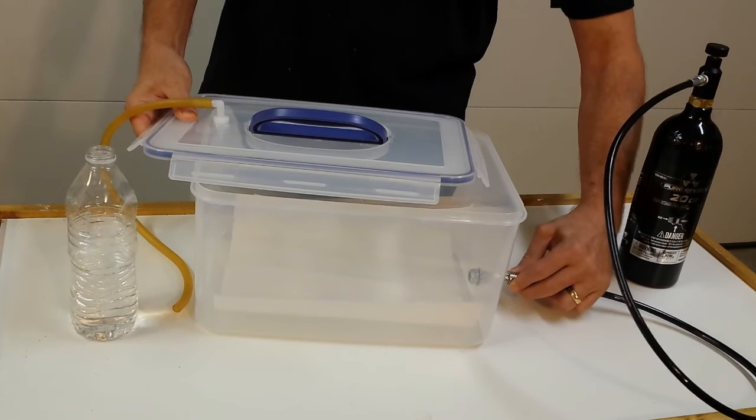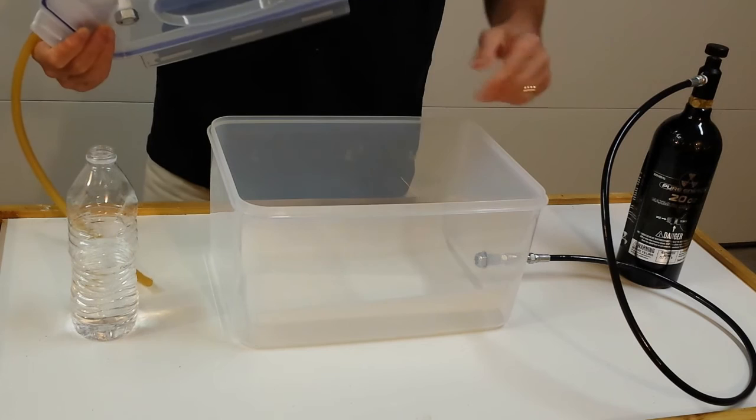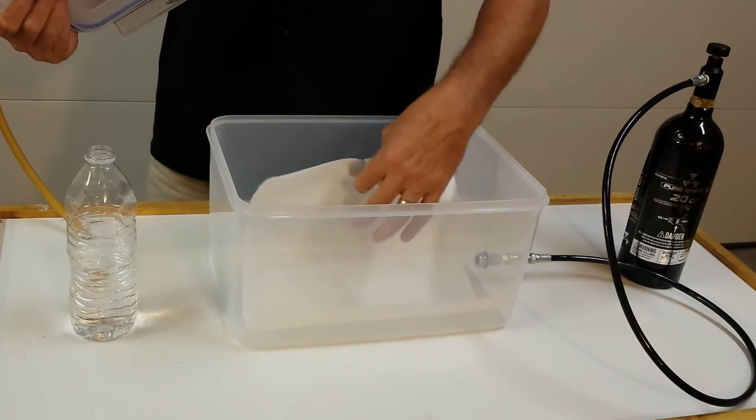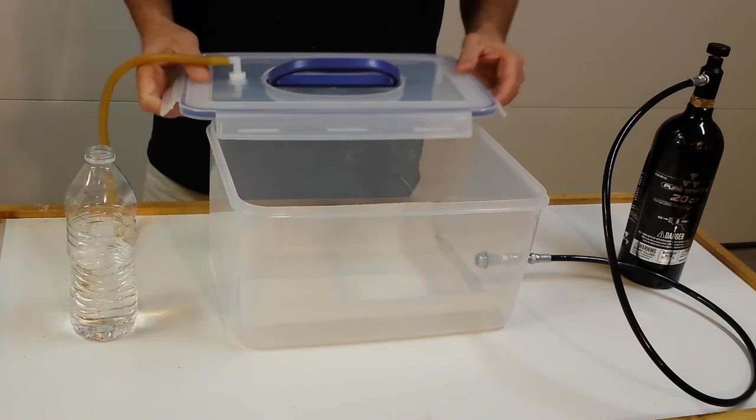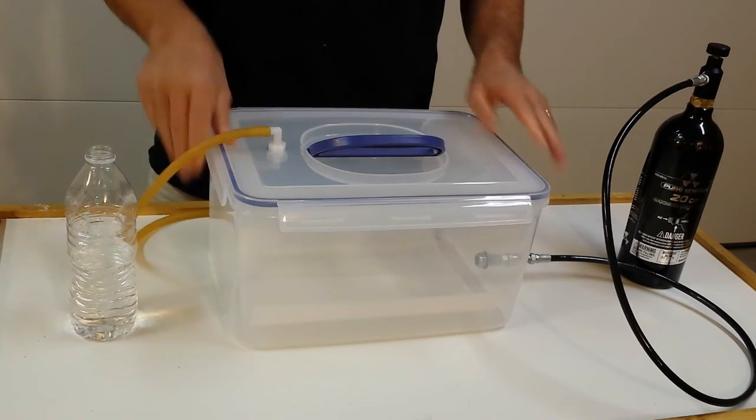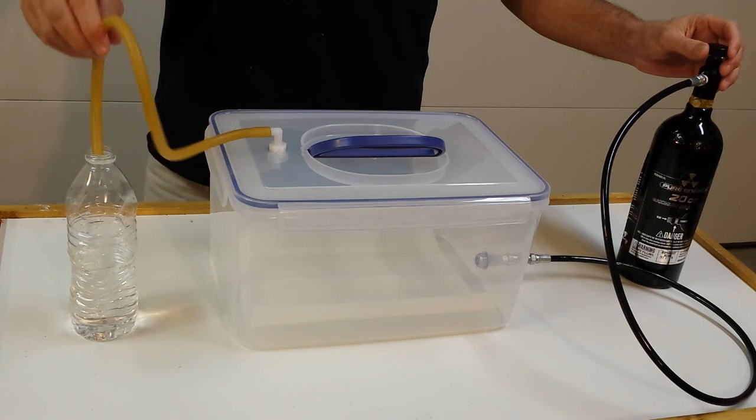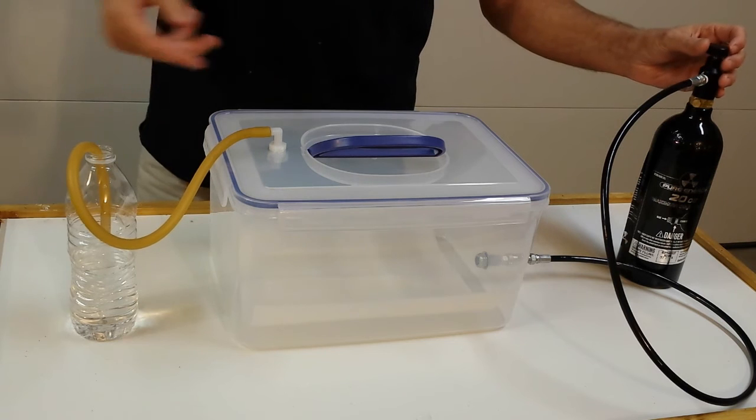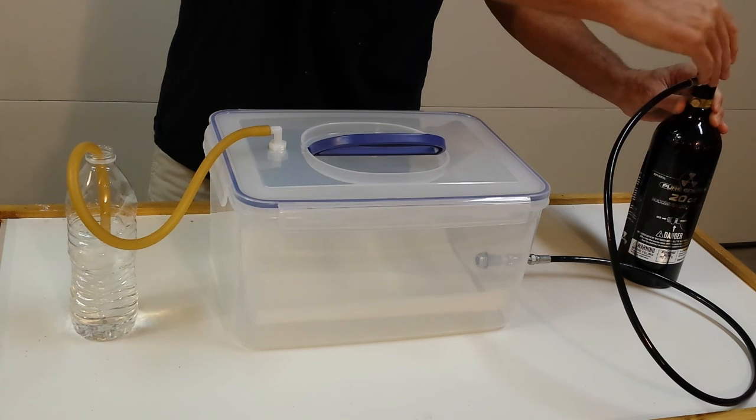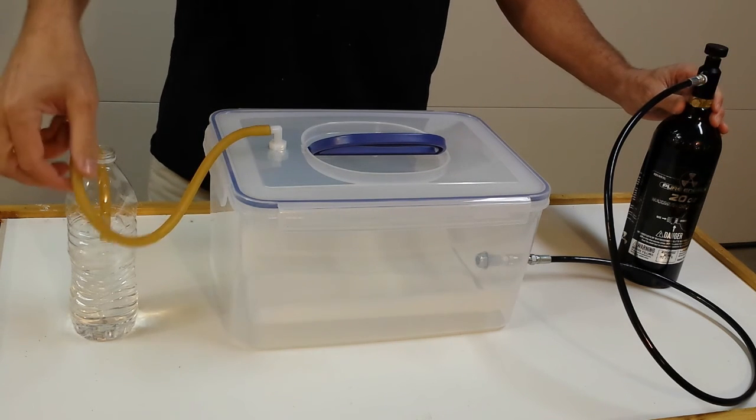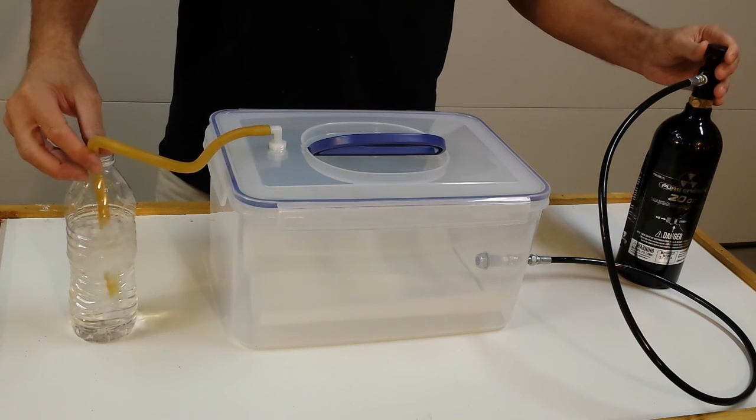Over on this side, the quick connect is fitted on to the end, bolted in the inside. This latches on like that. So I also always put a piece of paper towel or something in the bottom because they tend to urinate sometimes, and that just kind of keeps things clean. So just put them in, lock it up. Stick the hose down in here. I don't usually put it in the water right away. I just kind of listen for the air to start running, and then I drop the hose in.